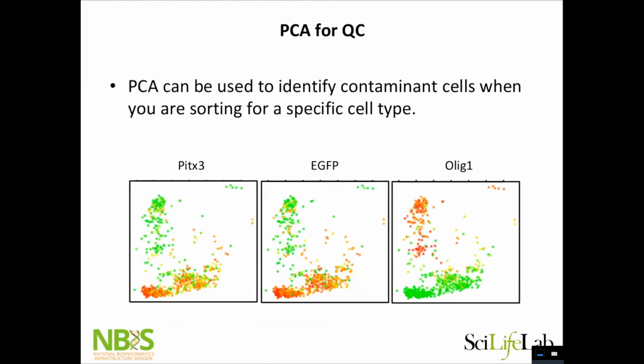And you can actually sometimes use it to detect contaminants. Here is one project where we're working with Pitx3 EGFP cells. And then we have clearly in the PCA these cells that we didn't really want in the analysis. So just based on PCA, we can remove all the cells that we don't want to analyze.